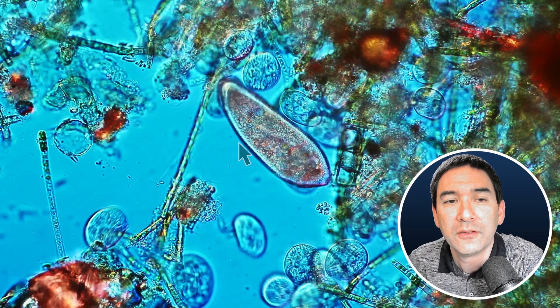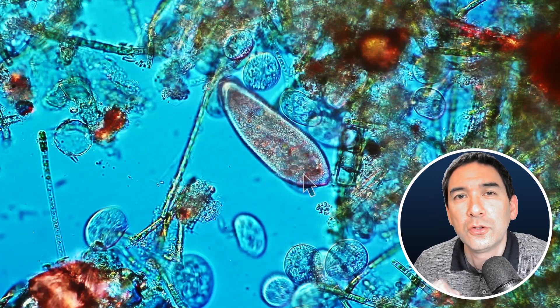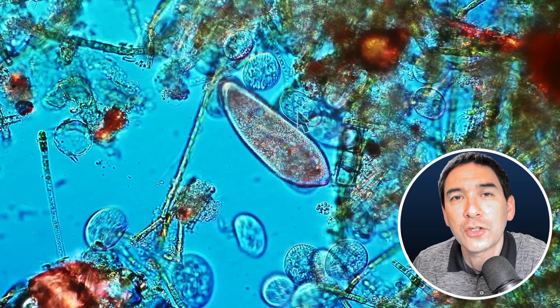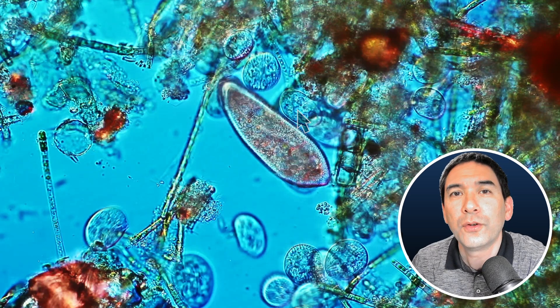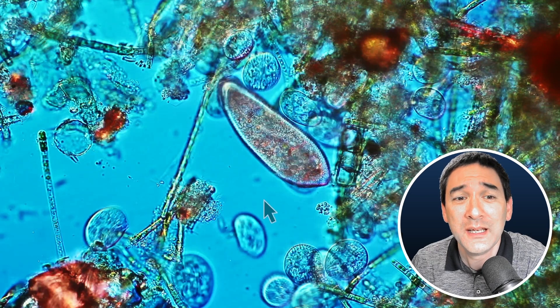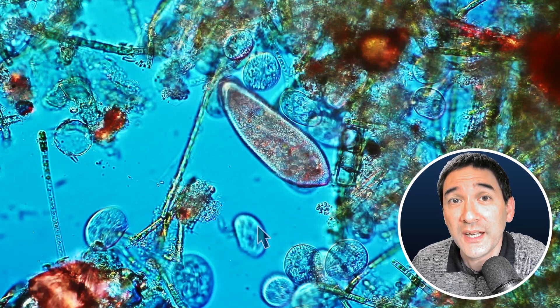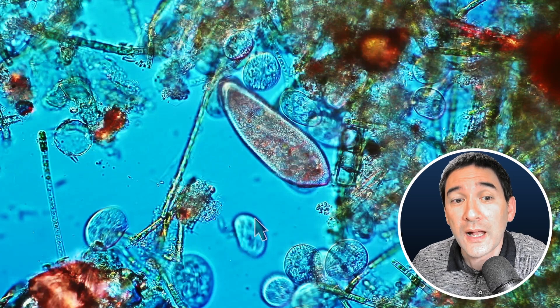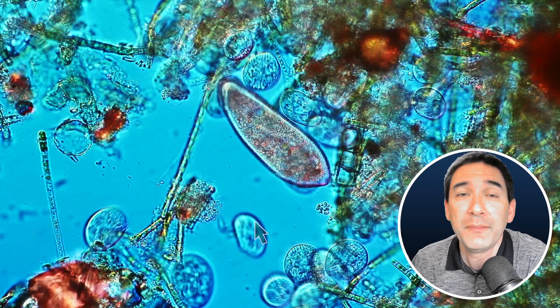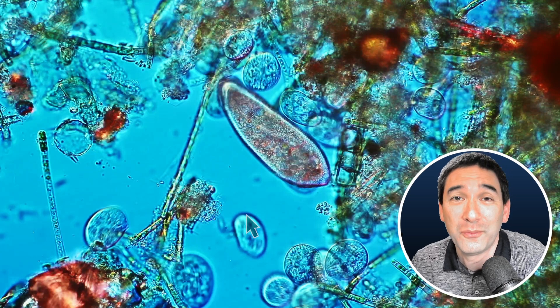Pretty much all of them have that. I would simply want to explain to you, however, that the cell membrane is still too thin to be seen. And the dark line that we have here is actually because of the differences of refractive index. We have to explain what that means: the inside of the cell has a different refractive index from the outside, and at the border we are actually able to see this dark line. So this is something that the microscope produces, and is actually not the cell membrane itself, which would be too thin.